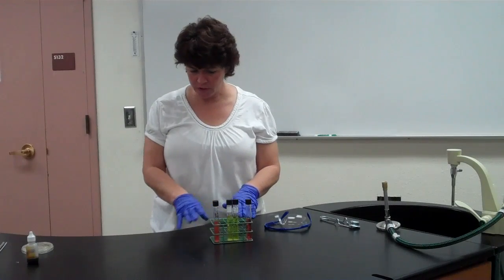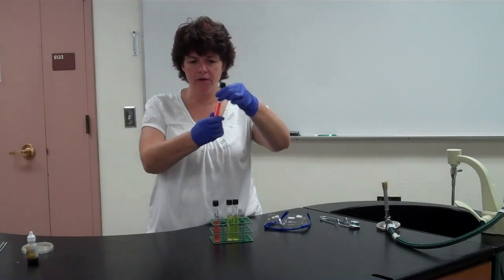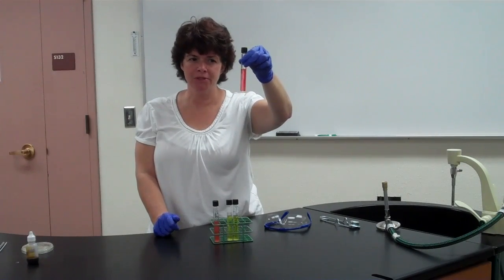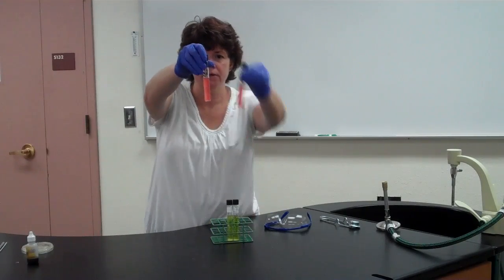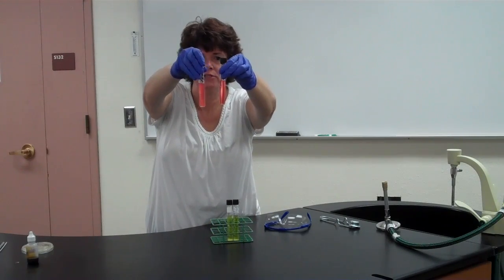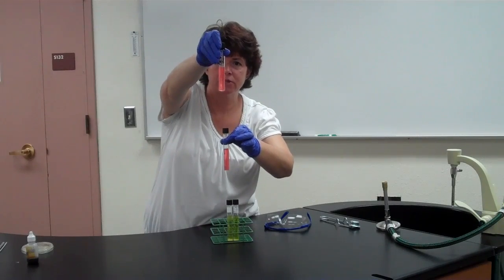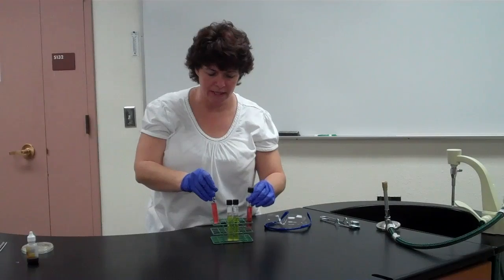Now we have some results here that I wanted to demonstrate. So this original tube right here is what they look like to begin with. They're red, there's no gas, maybe a darker red than that, okay? Now this tube right here and this tube right here are essentially the same color. The difference is this tube has bacteria growing in it, okay? It's cloudy. So the first thing that you want to look at, if it didn't change color, look for growth.